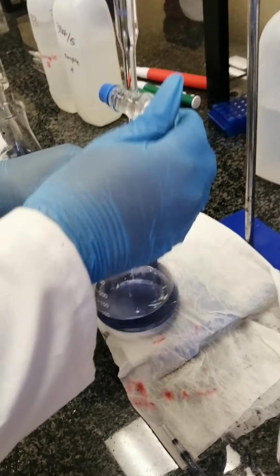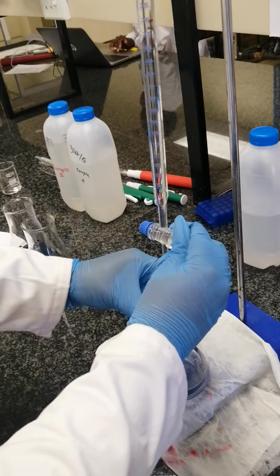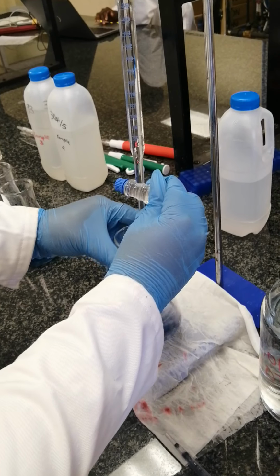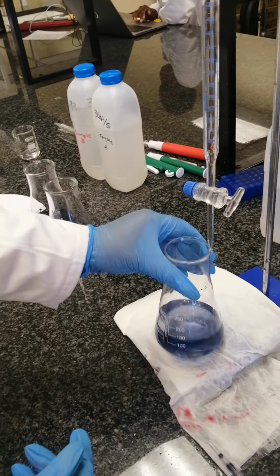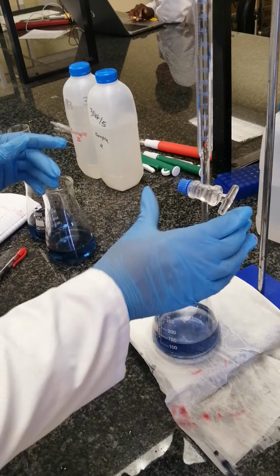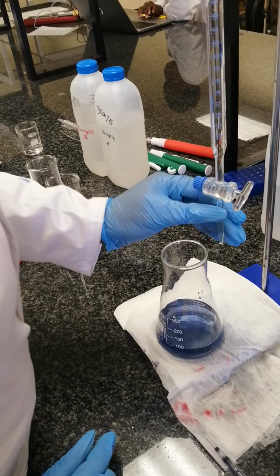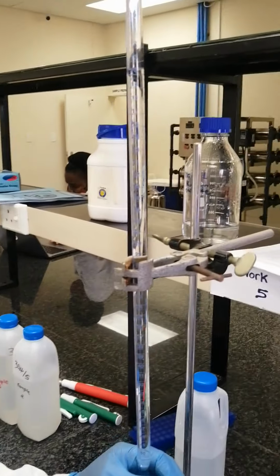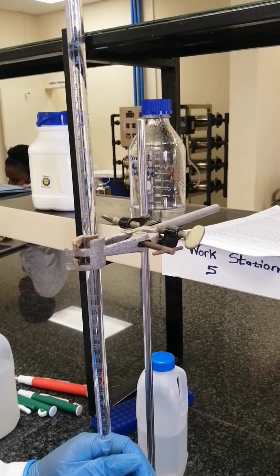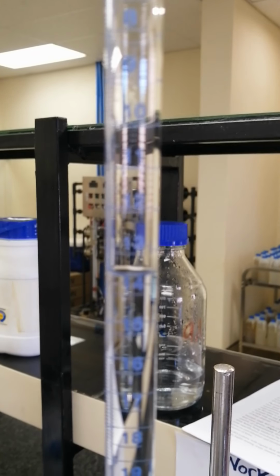Then we are fine. So now you can see that your water changed to blue as in the first beaker. Okay, this is the one that we need. So this is the blue color. Okay, let's put the last drop. Then as you can see, our water sample turns blue at 13.6. So the third trial is 13.6.